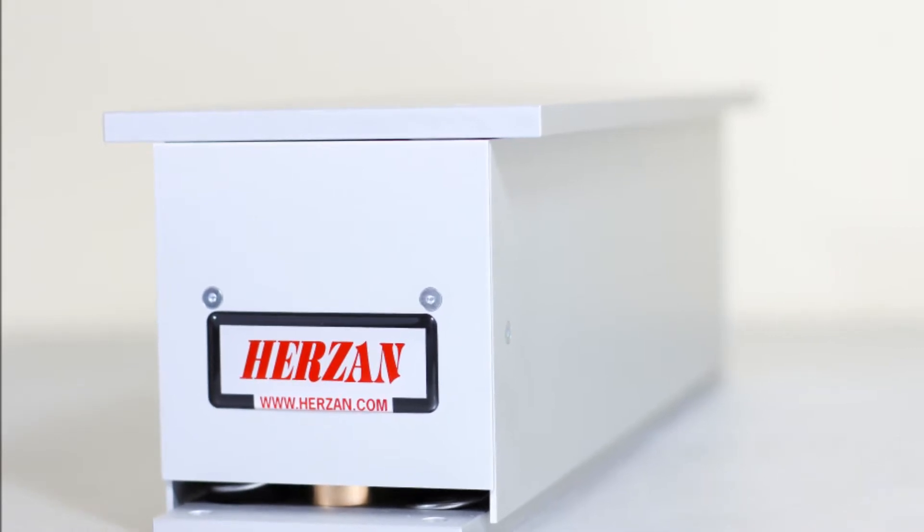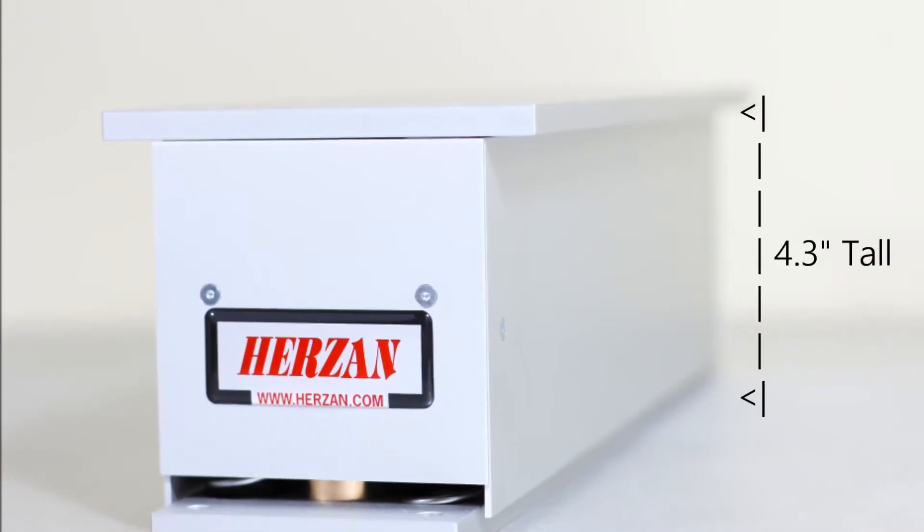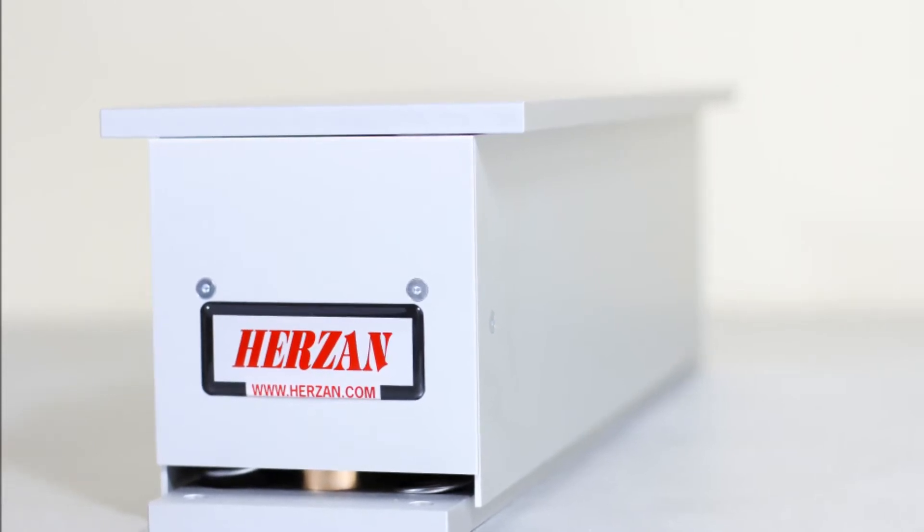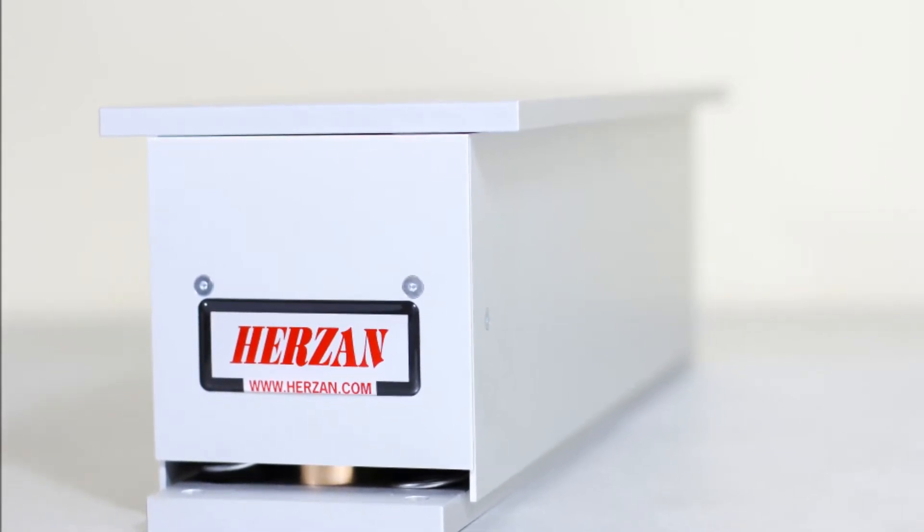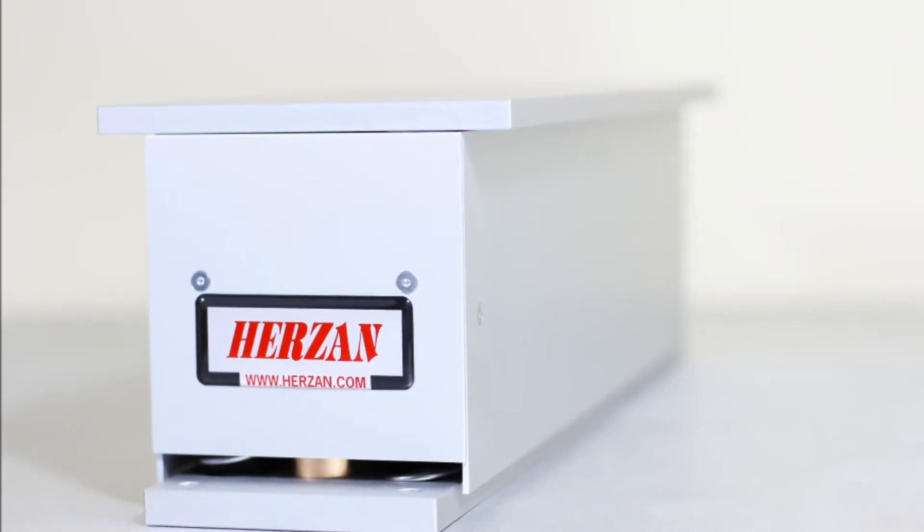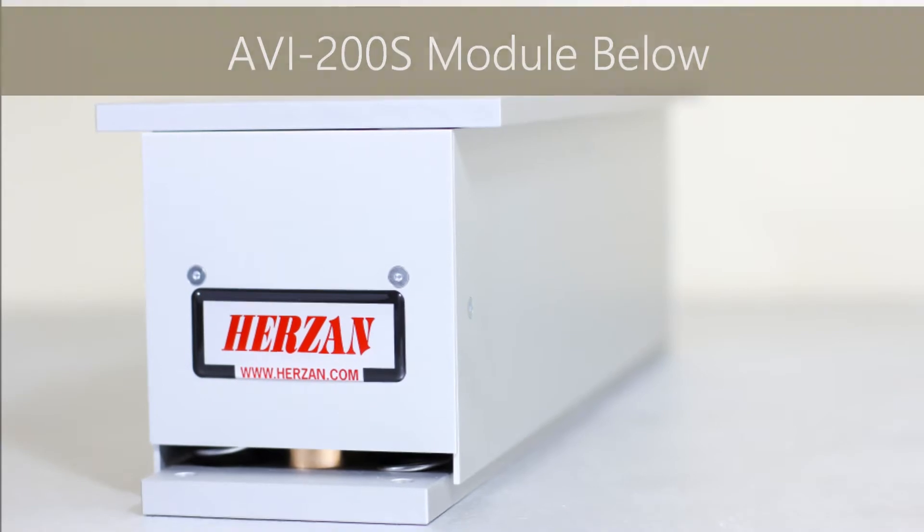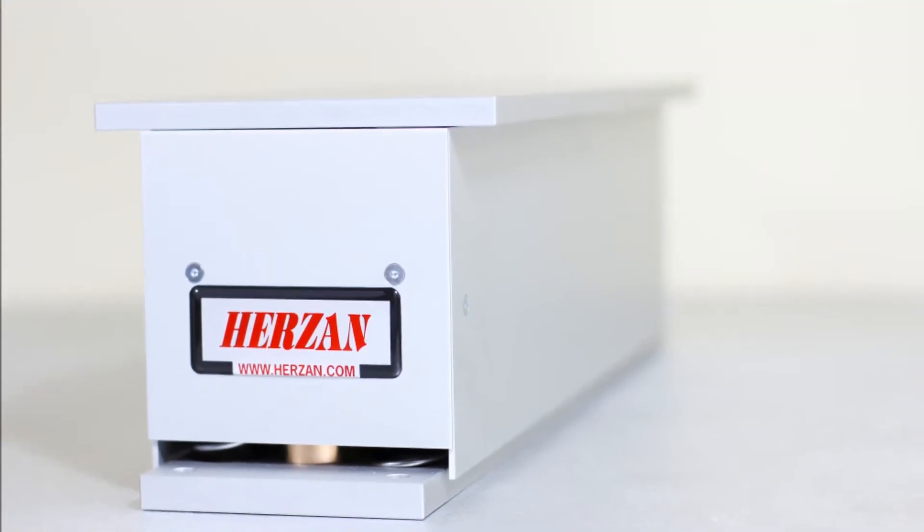With its low profile and modular design, the AVI series makes it easy for researchers to perform installations in under an hour without the requirement of lifting equipment. This tutorial video reviews the installation procedures for every AVI series platform, outlining each step of the installation and adjustment process.